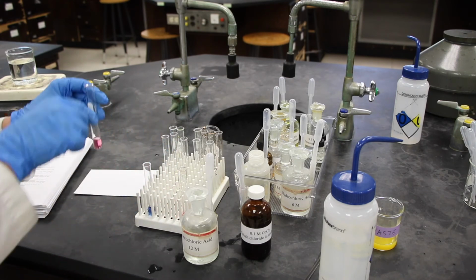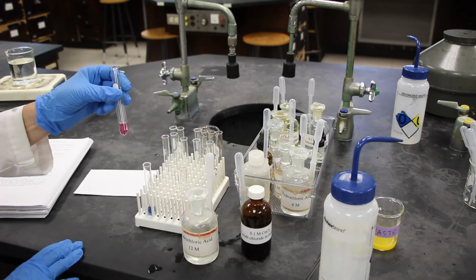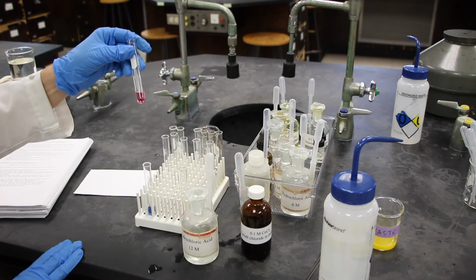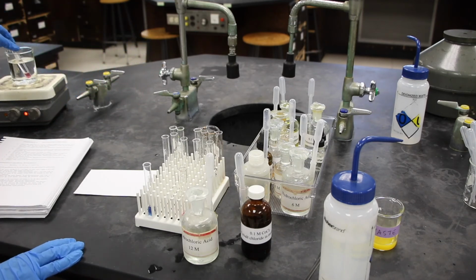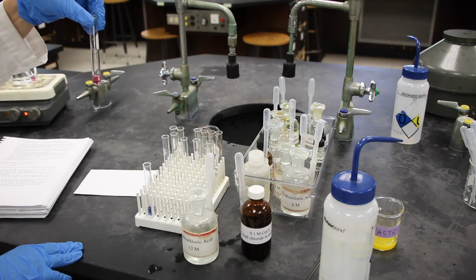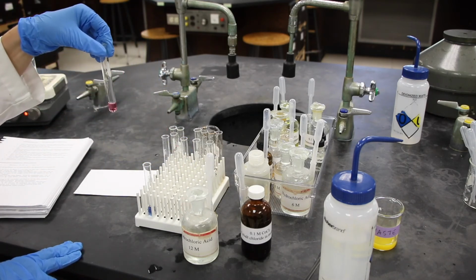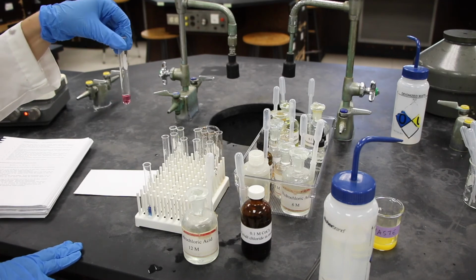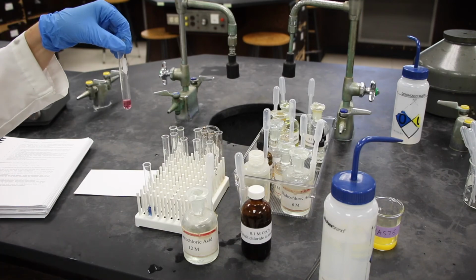And in the second test tube, in step 6, we're going to place that in a hot water bath. And I'll do that. We'll check that in a minute. It takes a little while. And in the third test tube, we are going to place that in an ice bath. And I've got some ice here. We're going to wait a few minutes and then come back and check these.